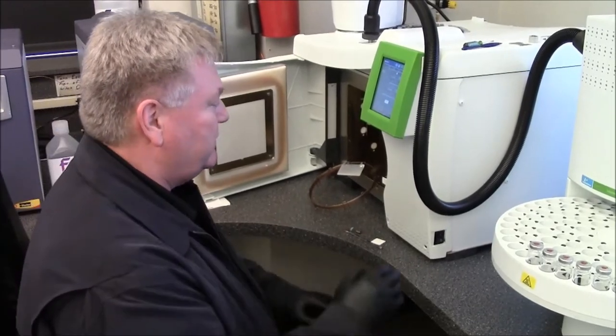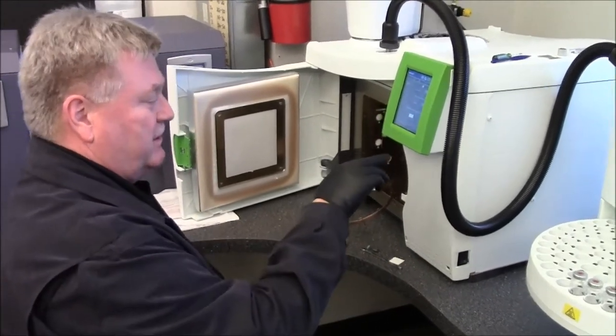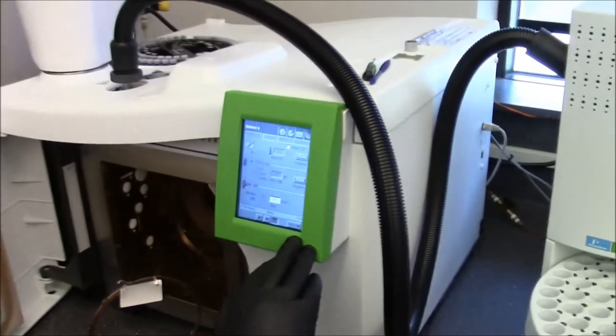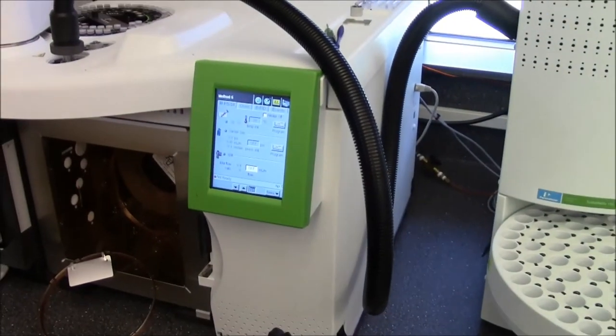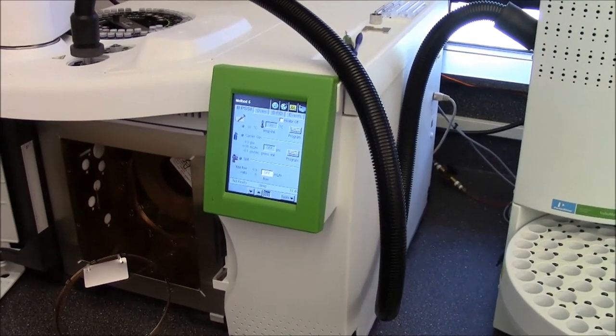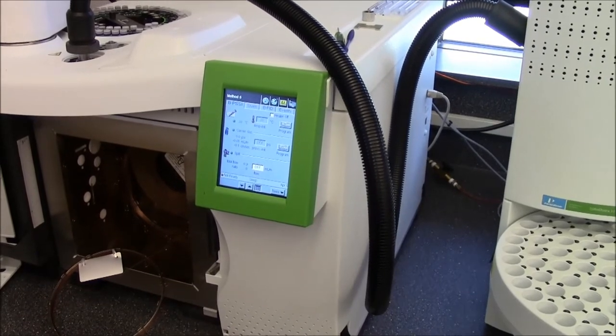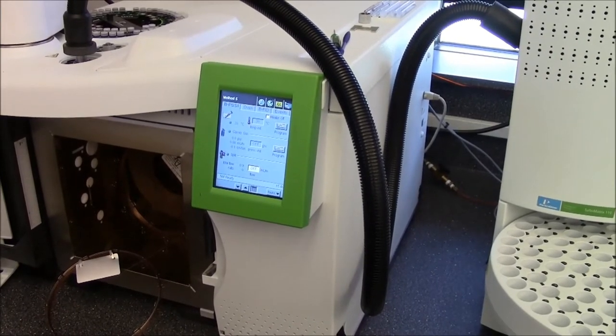So the one thing that Perkin Elmer does, if you want to see here on the screen, a lot of people, like Einstein said, you don't need to remember everything. You just need to know where to find the answers to it.